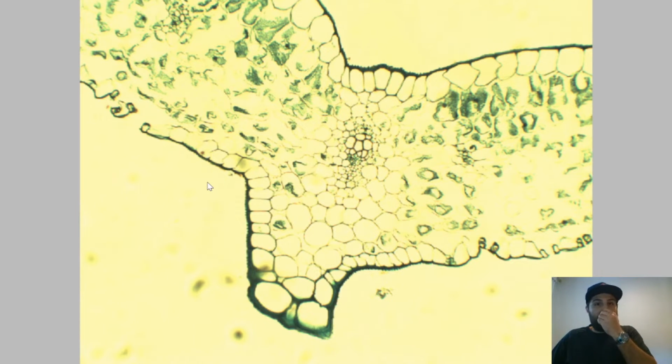But what we want to look at here is the different cells, the different parts of structures that are present here, and probably talk a little bit about their functions as well. So firstly, on the top layer of the leaf here we have the cuticle, and on the lower level we have the cuticle. The cuticle is helping stop water loss in hot, dry climates. So if we go to our leaf here, because we're going to be a bit tree huggery in this, you have our leaf here, quite waxy, quite rough feeling, almost leathery feeling. That's that waxy cuticle that's stopping water loss in our hot, dry climate here in Australia. That's why our leaves are staying green for quite a lot of time on the trees there.